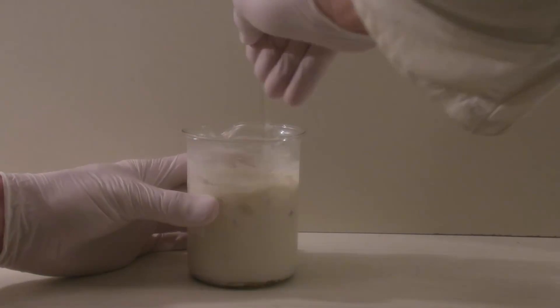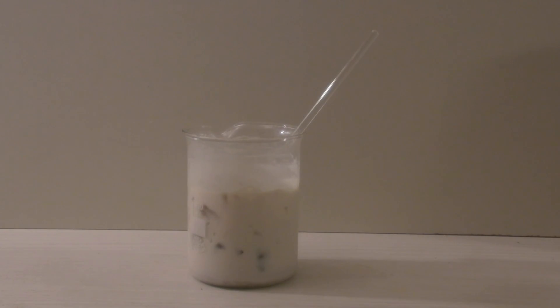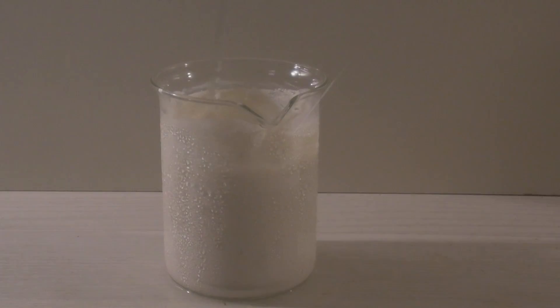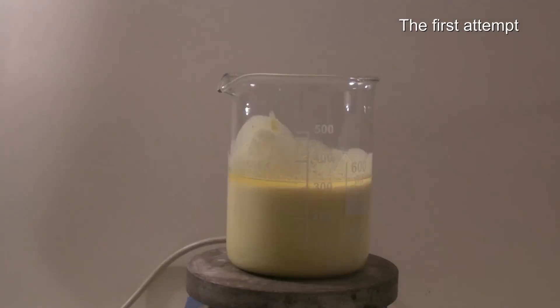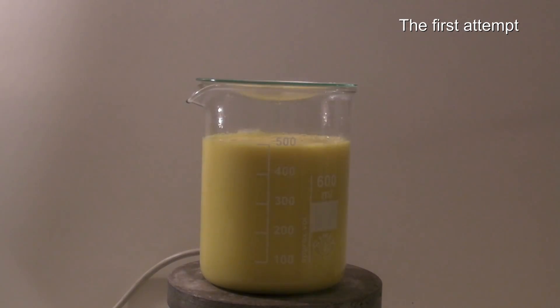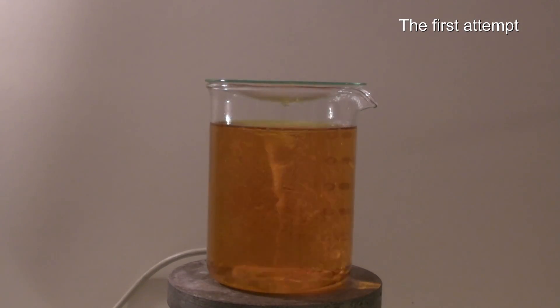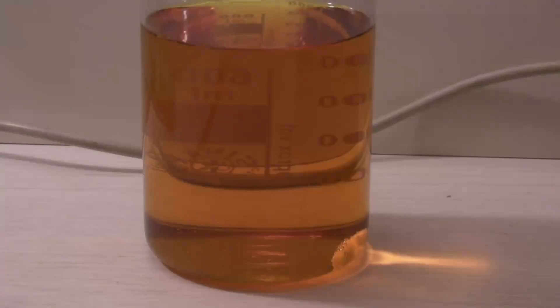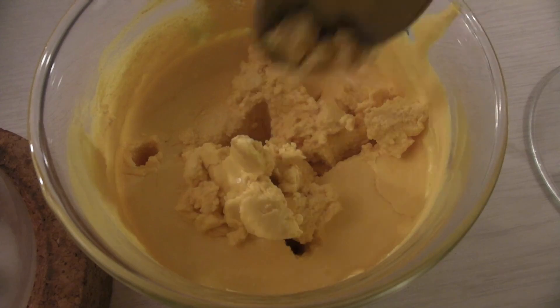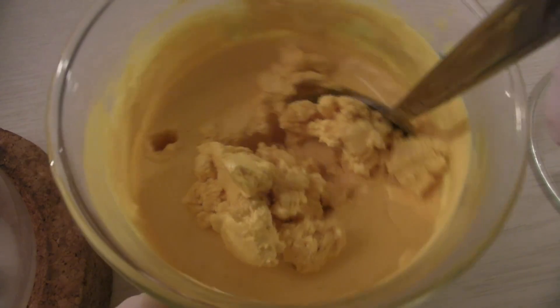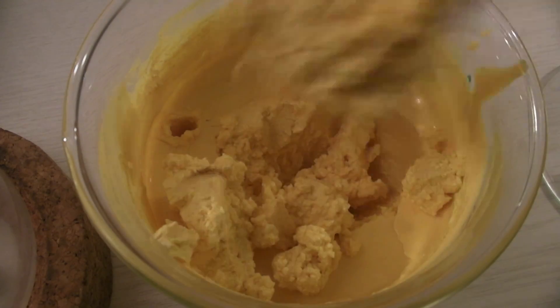It would be possible to add the ice to a round bottom flask and add the mixture directly so that it doesn't have to be transferred afterwards. In lots of papers the p-nitroacetanilide is washed and recrystallized. I would recommend to leave this step and work with the mixture after the ice has molten because the effort is not needed. It has been left for 2 days which is why it had become yellow. This is not a problem because the reaction which is responsible for this will be used in the next step.